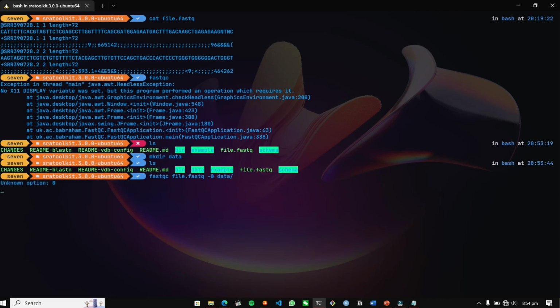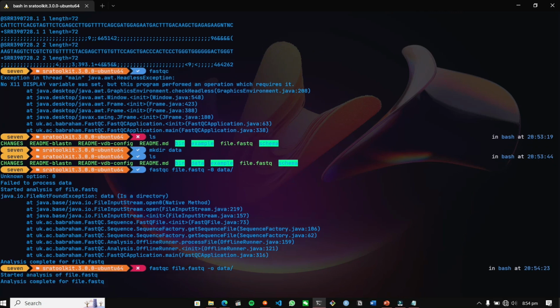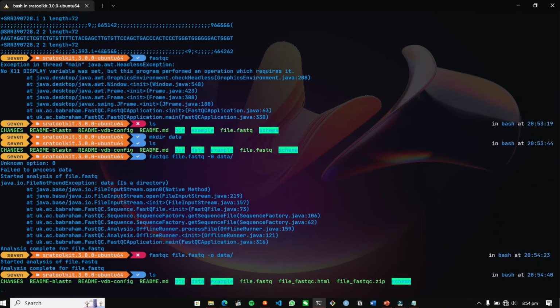It is saying analysis complete for the file. I think I have done something wrong. I should have included the O option. I included 0 there, so that was the main problem we were causing. So here we got the FastQC quality control in our folder.